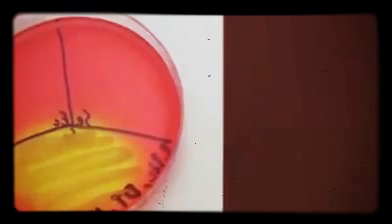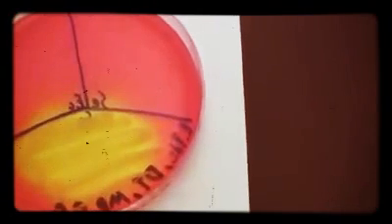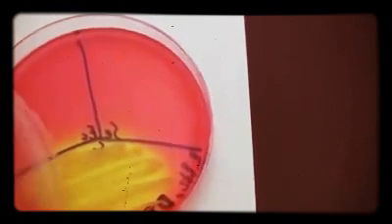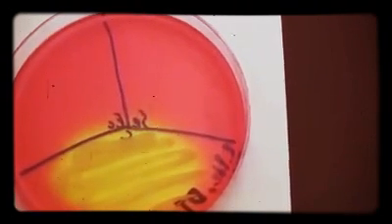Now also on this plate, we have another organism that's able to grow. I don't know how well we'll see the growth here, but it's up in this upper third. There's growth, but you don't see that yellow color changing. So meaning that the organism is halotolerant, it's gram-positive. However, it cannot metabolize mannitol, so you don't see the yellow form.